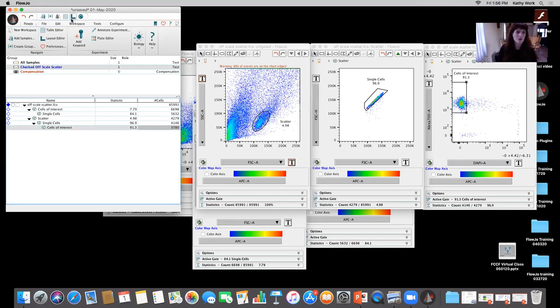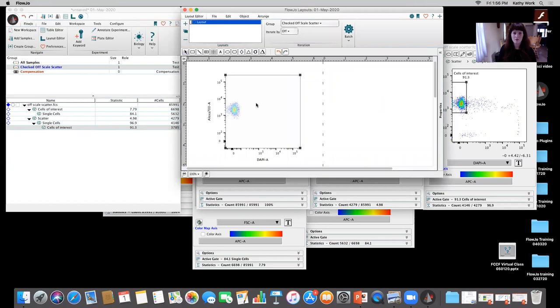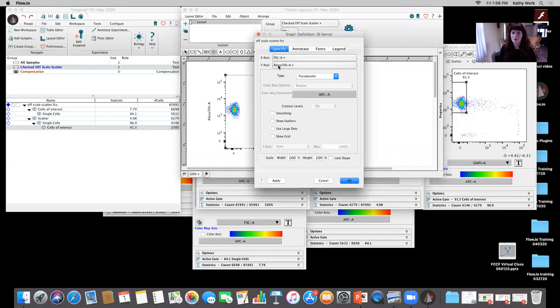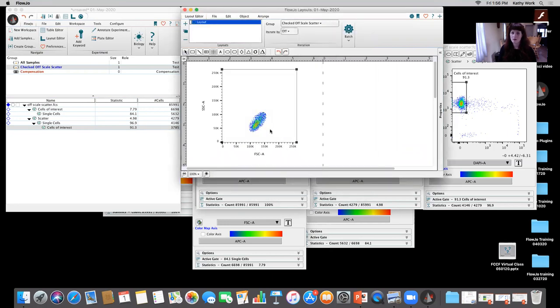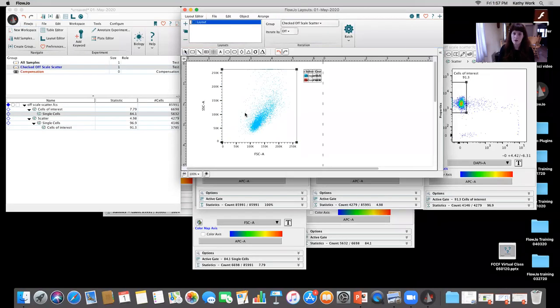And I could always come in and show you quick, if I do a quick overlay, the difference in scatter there and those cells. So if I drag in those cells of interest right there, I double click here and the x-axis I look at forward scatter and the y-axis I look at side scatter and I hit okay, right? This is where if I was tight on that scatter gating, but if I thought a little bit differently about my gating strategy, there's a difference there, okay? It might be hard for somebody to see where those original cells were, so what we can do is click right here and drag it up and you can see that difference.